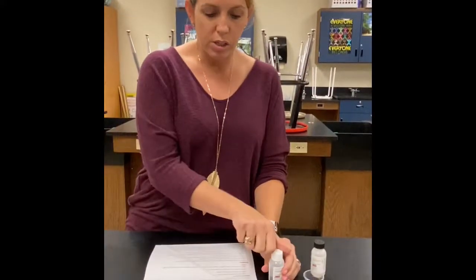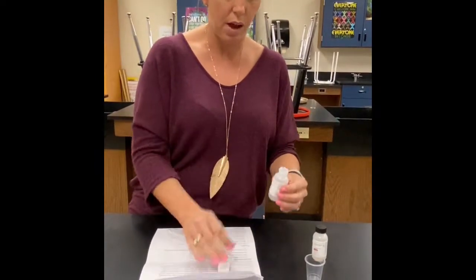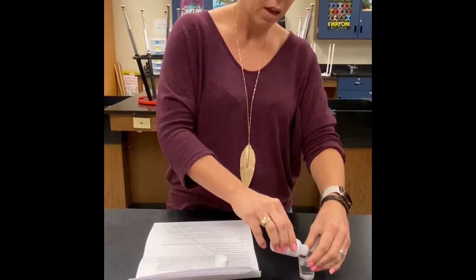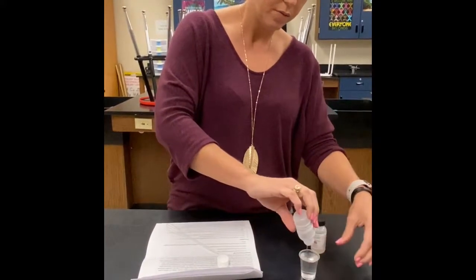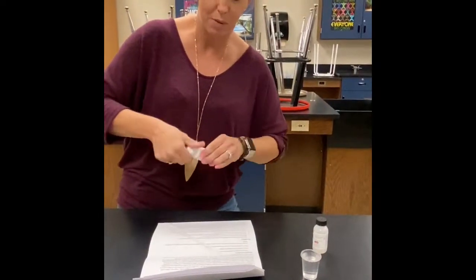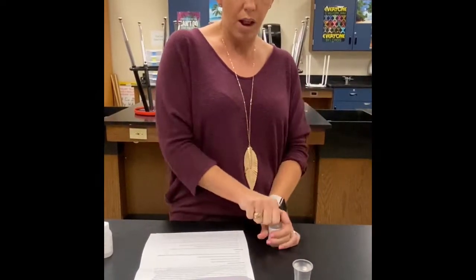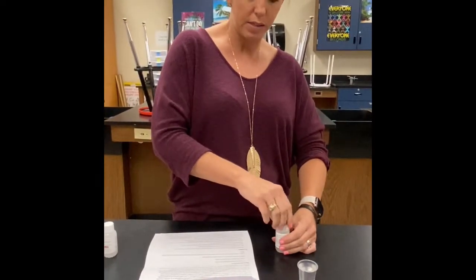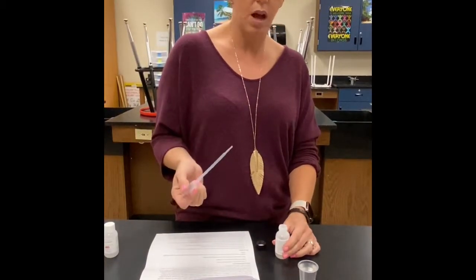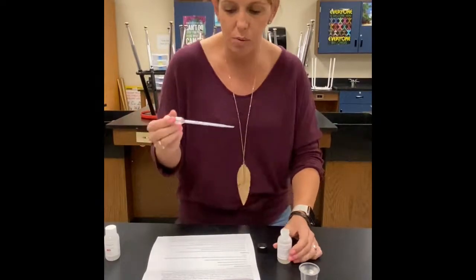So we are going to pour one bottle of the luminol solution into the plastic cup. So I'm going to pour this whole bottle into this cup. Oh, okay, it's really close to spilling out, so be very, very careful with this. The next part, we're going to have to make sure before we place this hydrogen peroxide into the cup that the lights are out. So I have to get 1 ml of the hydrogen peroxide.